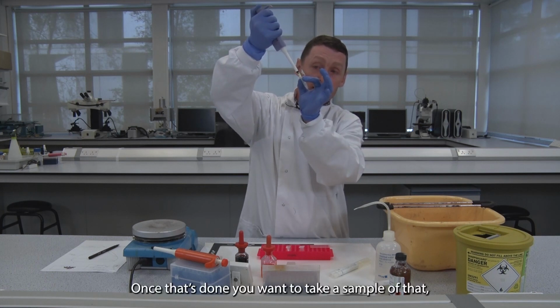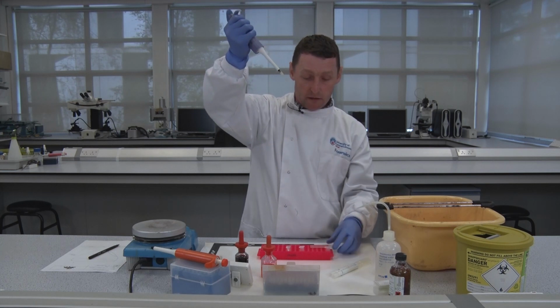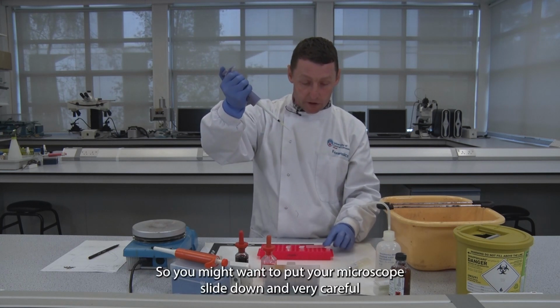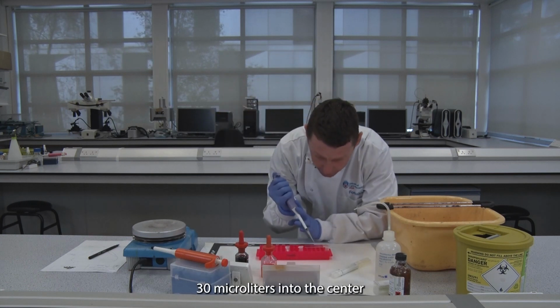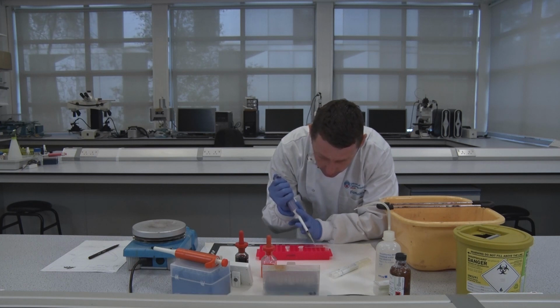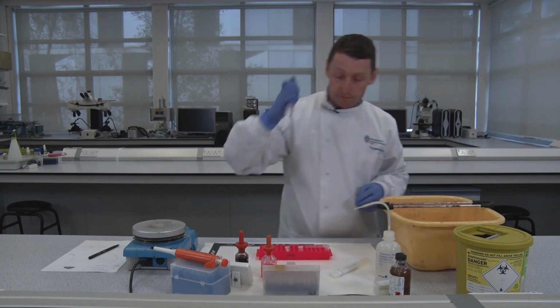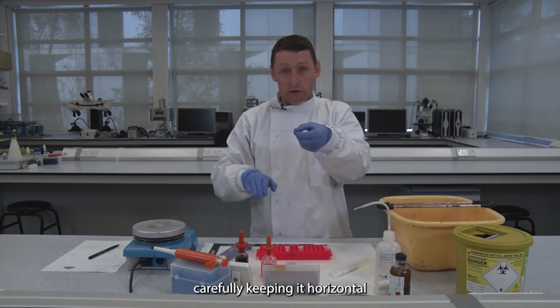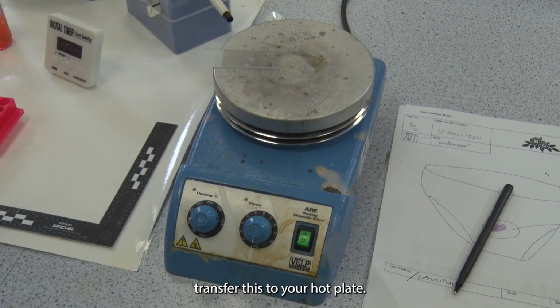Once that's done, you want to take a sample of that, approximately 30 microlitres, and apply this into the centre of your microscope slide. So you might want to put your microscope slide down, and very carefully, 30 microlitres into the centre of your glass microscope slide. Carefully keeping it horizontal, transfer this to your hot plate.